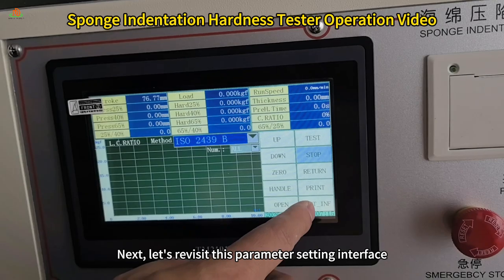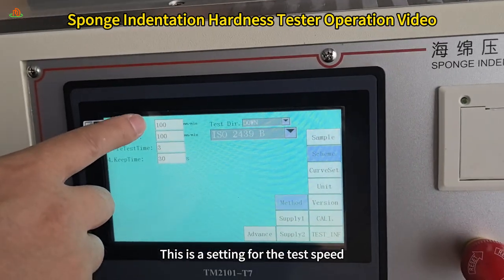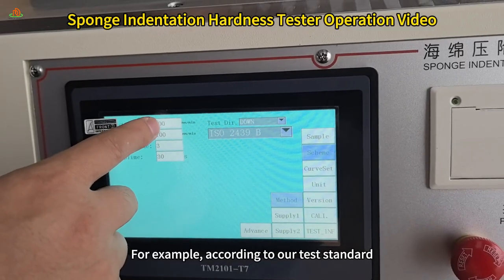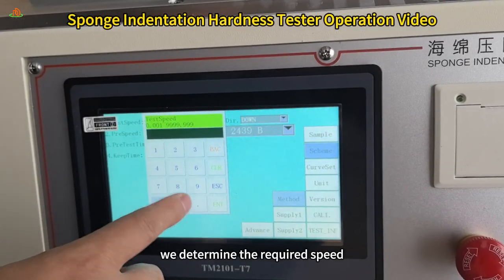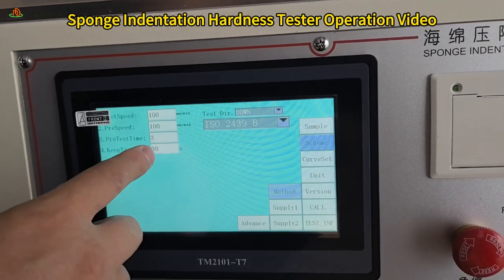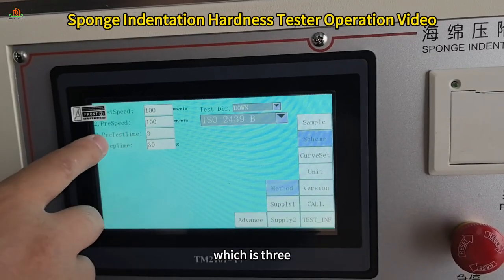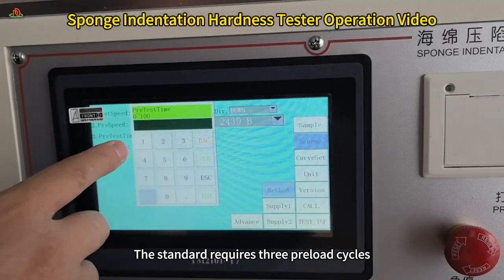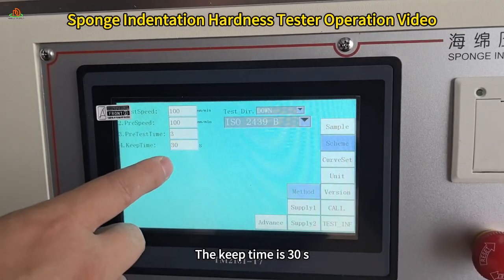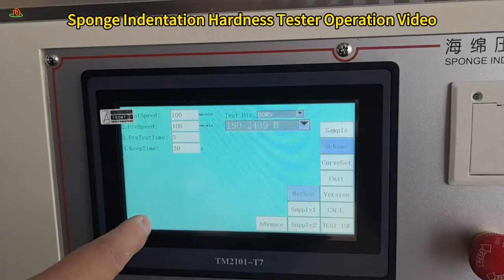Next, let's revisit this parameter settings interface. This is a setting for the test speed. For example, according to our testing standards, we determine the required speed, and then we enter the corresponding speed value here. This is the number of preload cycles, which is 3. The standard requires 3 preload cycles. The keep time is 30s. The standard generally requires a keeping time of 30s.